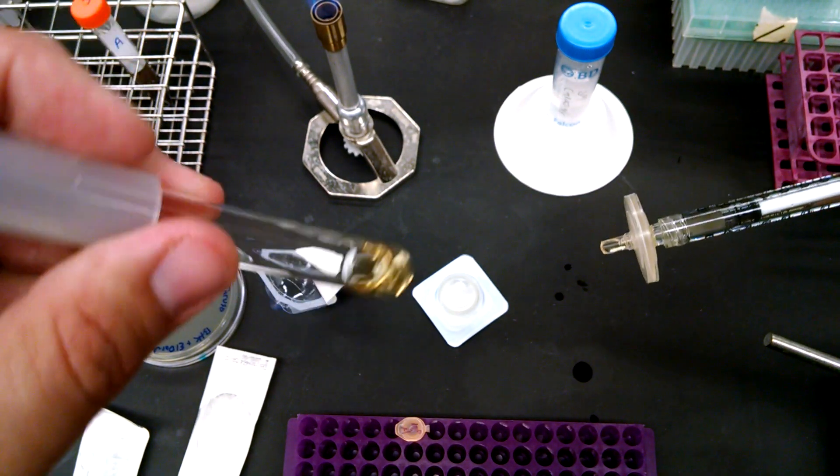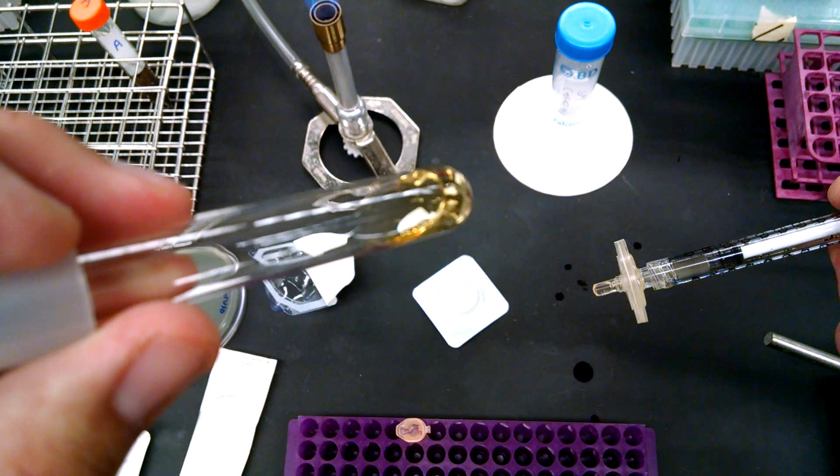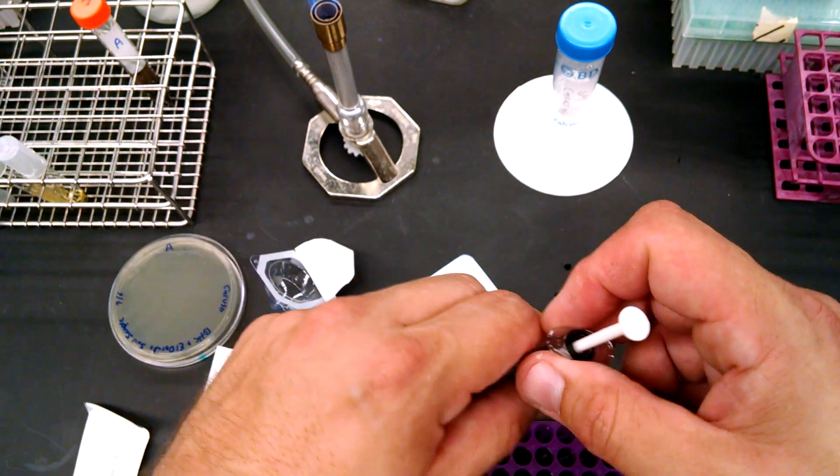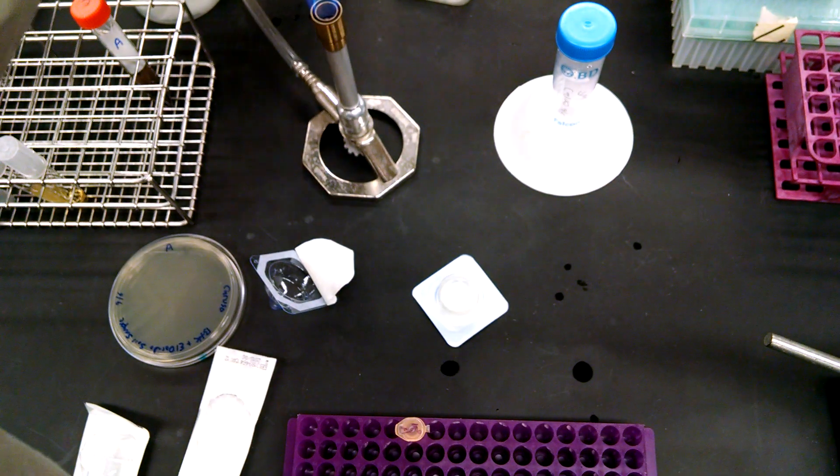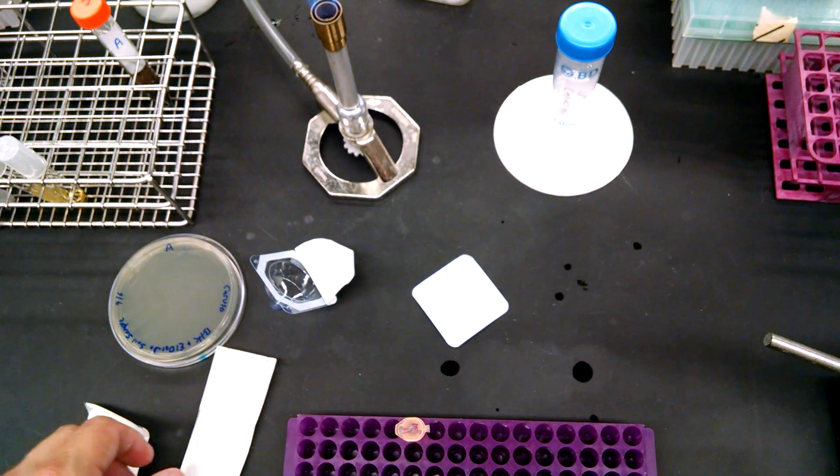Stopped all the bacteria. What we have is pure sterile media. That's what we're going to use this for. All right. So this one is done. This is trash. Okay.